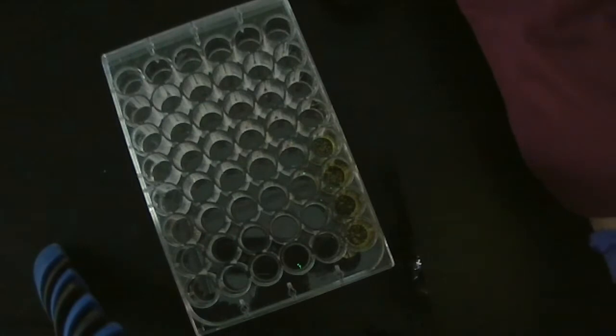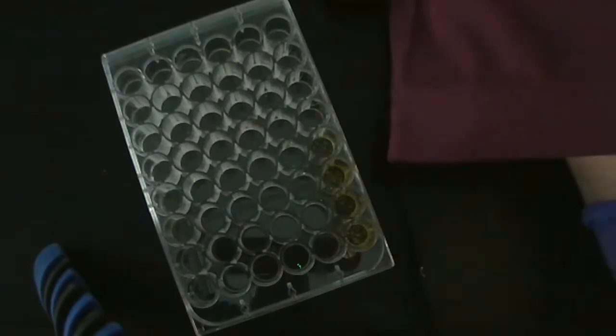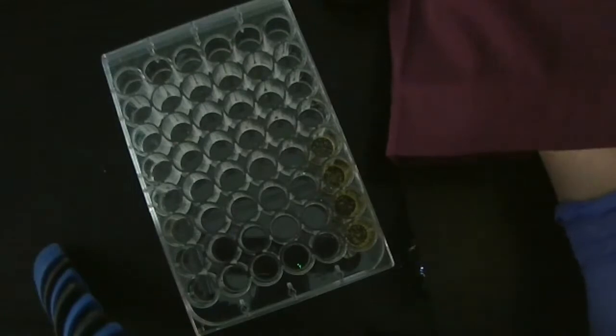What do we do next? We've tested these 3 in a variety of configurations. If you were going to try something else, what would you try?